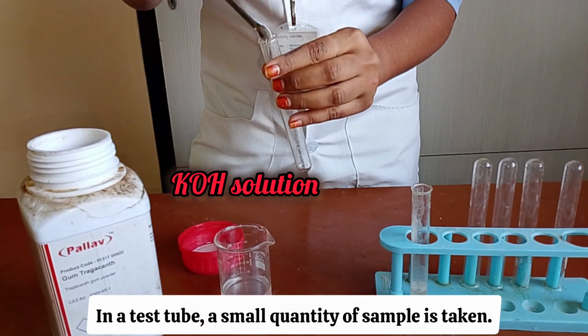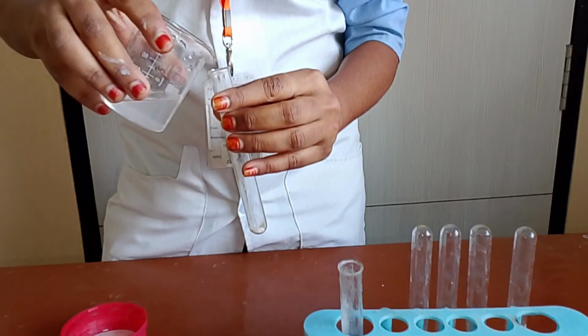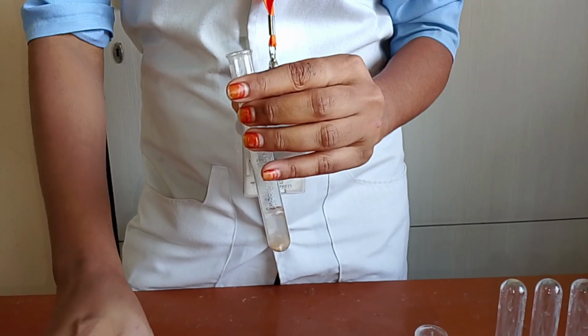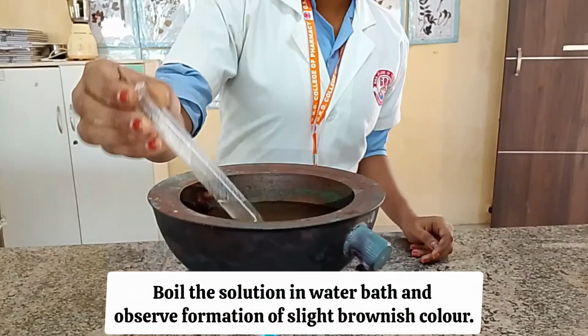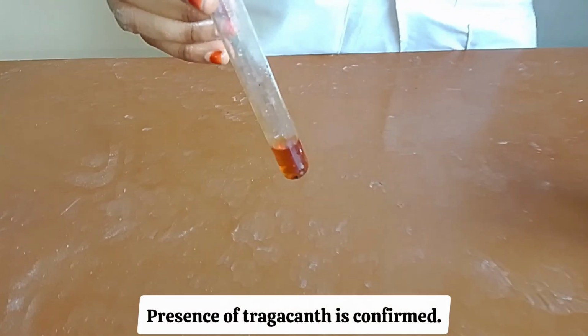In a test tube, a small quantity of sample is taken. To it, add KOH solution. Boil the solution in water bath and observe formation of slight brownish color. Presence of Tragacanth is confirmed.